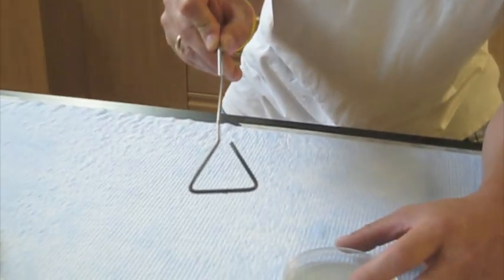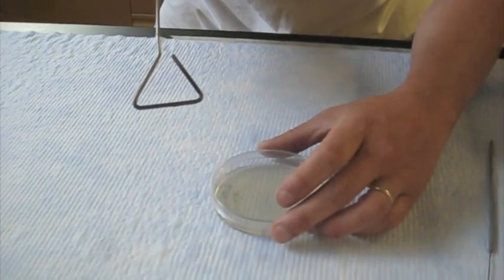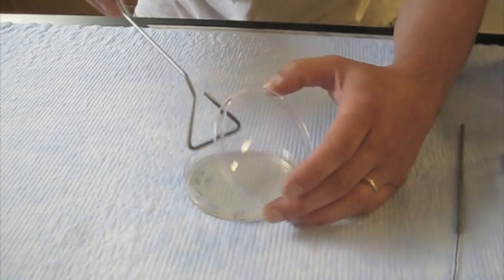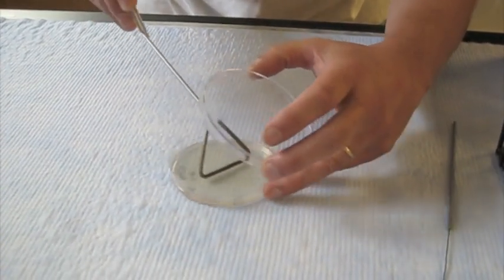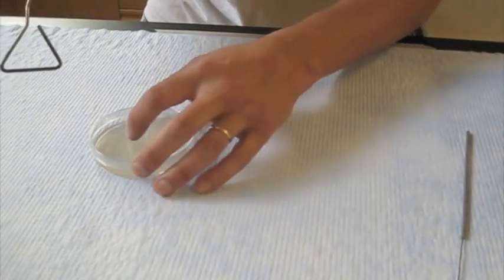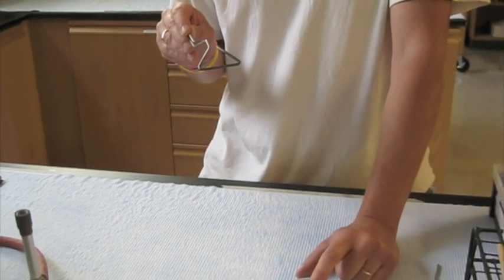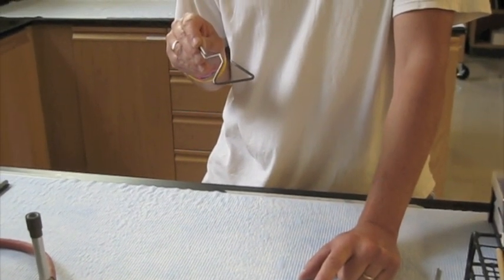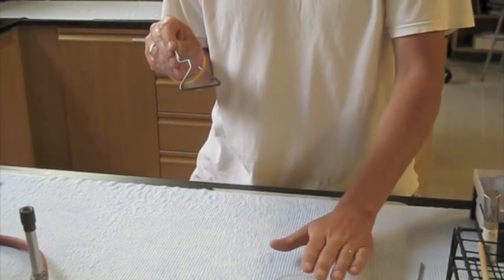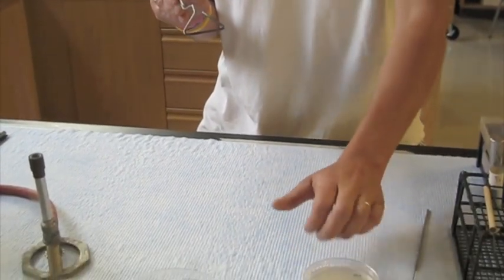Now what I'm going to do is tip this lid again as little as possible. Notice the way I'm holding the spreader this way, not this way. And I will put it here and back and forth, and you can carefully turn the plate a little bit and spread it around, put the lid back on. It's important now that we don't want to flip this immediately until the liquid has had a chance to soak in, otherwise it will form a bead on the bottom and be a mess. So we'll set that aside for a minute or so before we flip it.